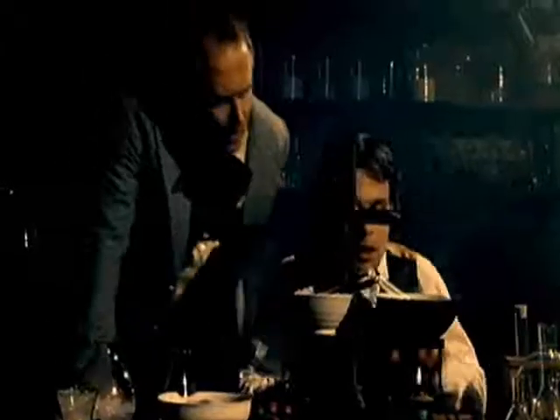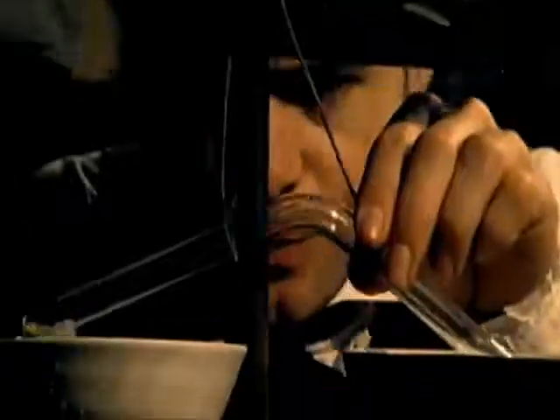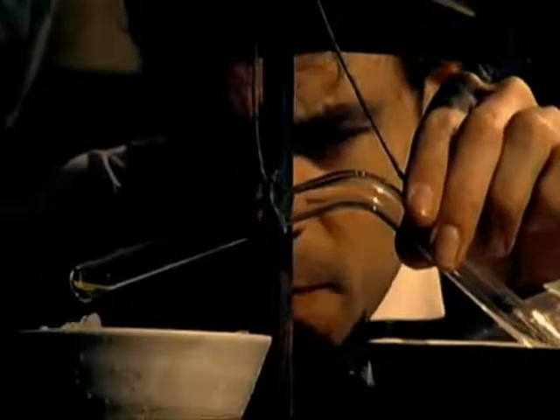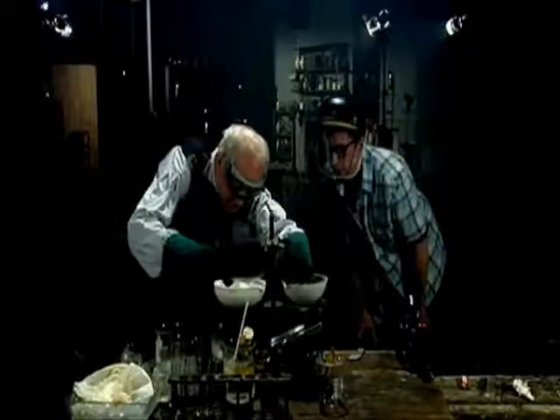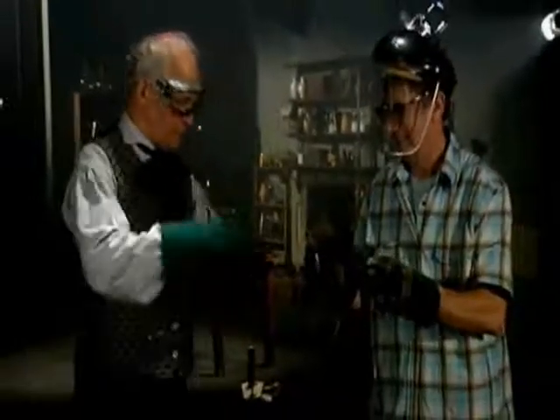When Faraday did the experiment, a visitor, Dr. Paris, came by to see what he was up to. Paris pointed out some oily matter in the bottom of the tube. Faraday was curious and decided to break open the tube. Right, so let's have a look inside here. The explosion sent shards of glass flying. With the sudden release of pressure, the oily liquid vanished. That's exactly what happened. It popped open, glass flew.